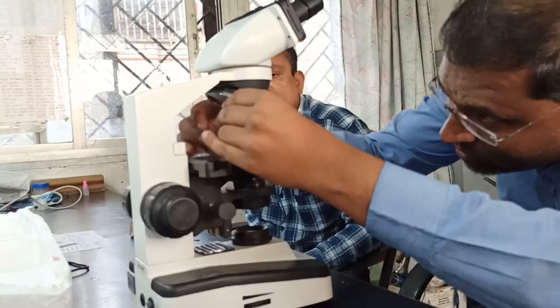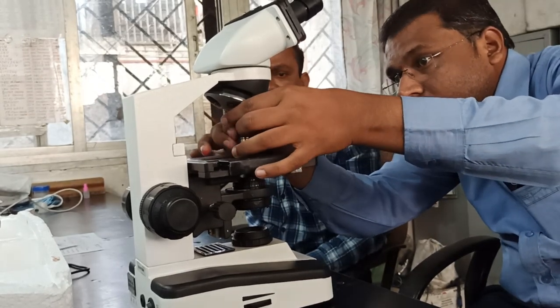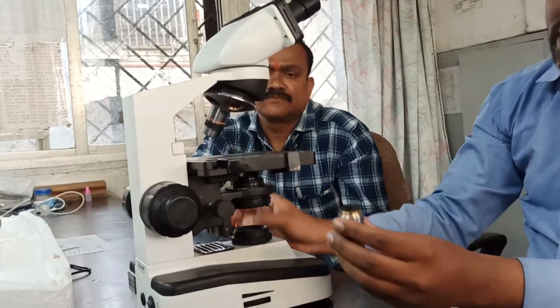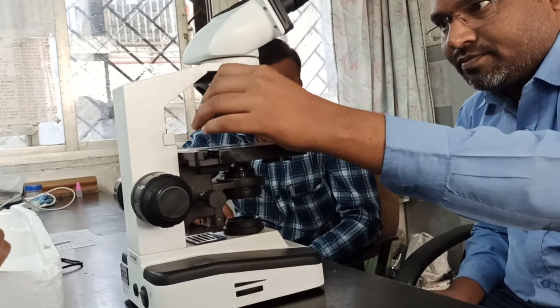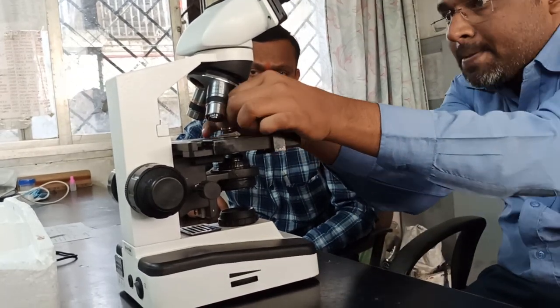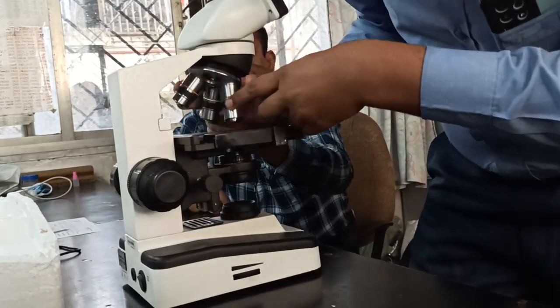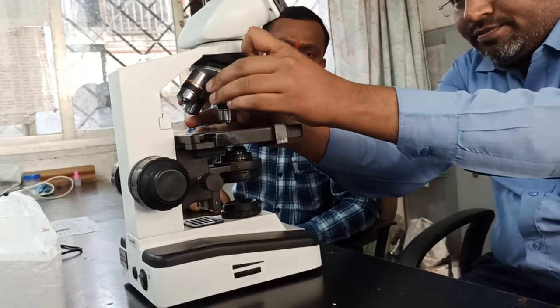During work you should take your time, it's good to avoid any major breakdown. It is not fixing properly. Fix one, right? The first lens has been fixed. Go for the second. Yeah, tighten it properly. This is the second one. This is your third lens. And this one is the fourth one. It is called a scanner. Just rotate it, fix it like this. The scanner gets fixed properly.